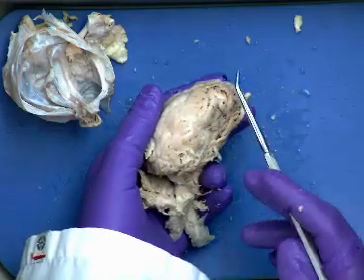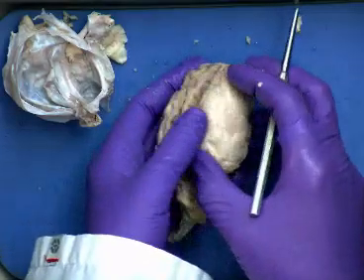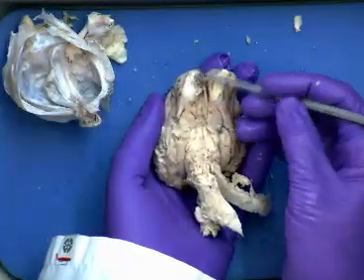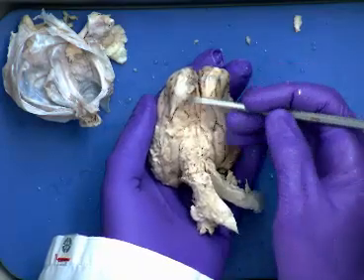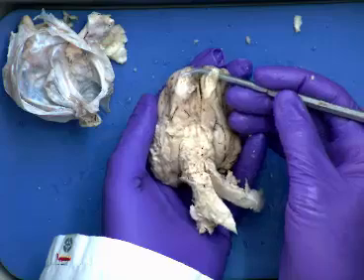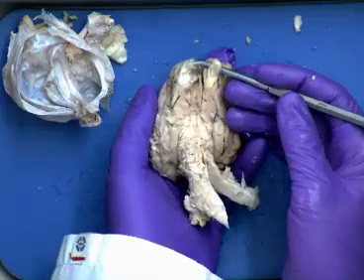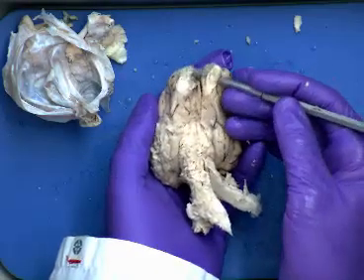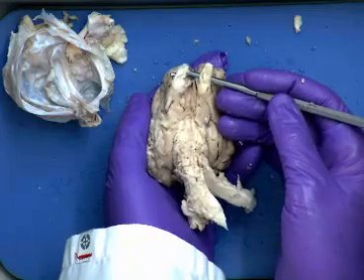Cerebral cortex, the cerebral lobe, cerebellum, pons, medulla, corpora quadrigemina we did, pineal gland, olfactory nerves, and bulbs. Here's the inferior surface of the brain. You see these here? Those are basically the olfactory bulbs as well as the nerve pathway that is going to continue through. Sheep do a lot of smelling of things, etc. So olfactory sensation, smell, is going to be routed through these nerve pathways here. Those are the first cranial nerves right there.